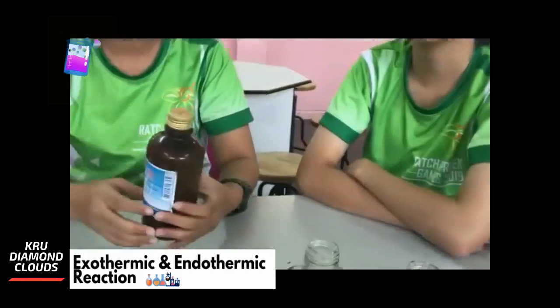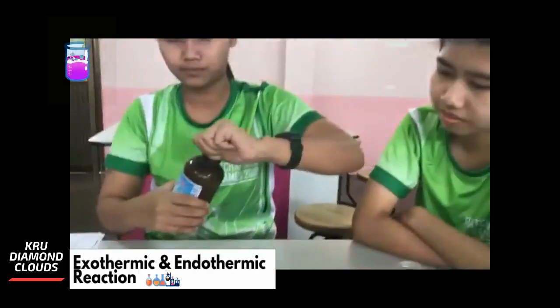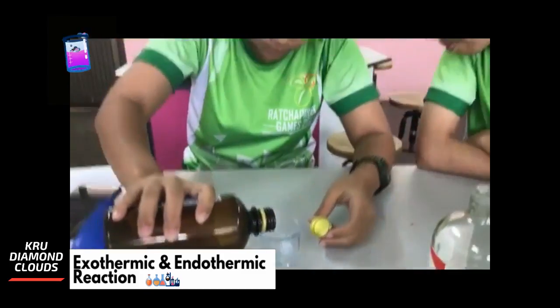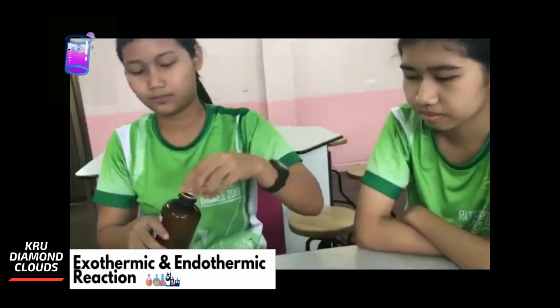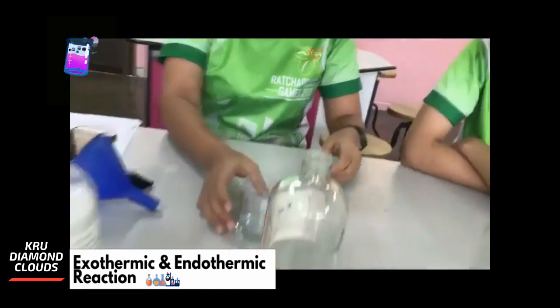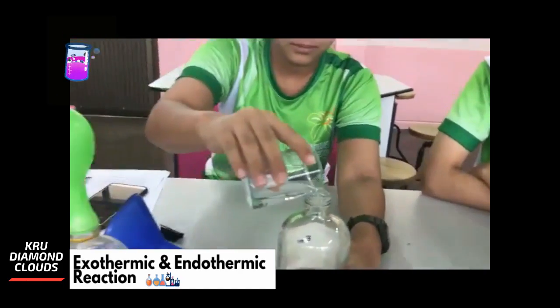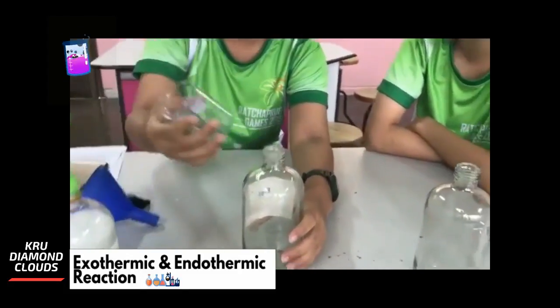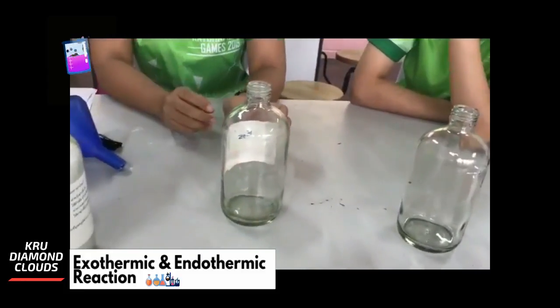You pour 20 ml of hydrogen peroxide into that beaker. Good. Now we're going to use this bottle to make the oxygen, so you pour it in.